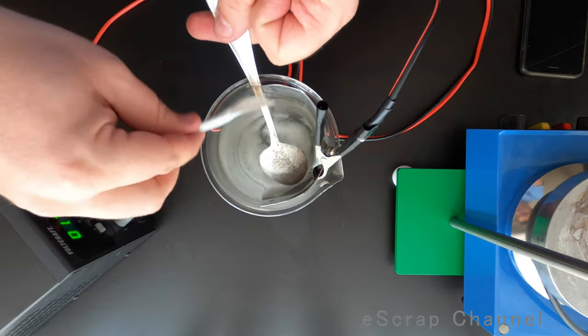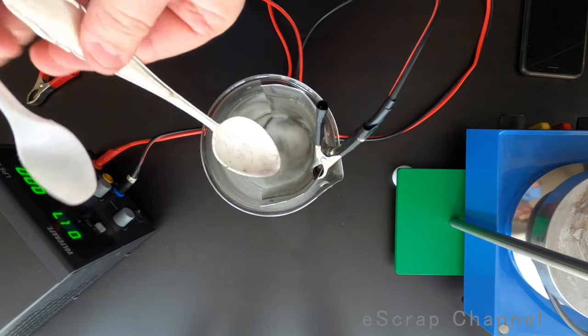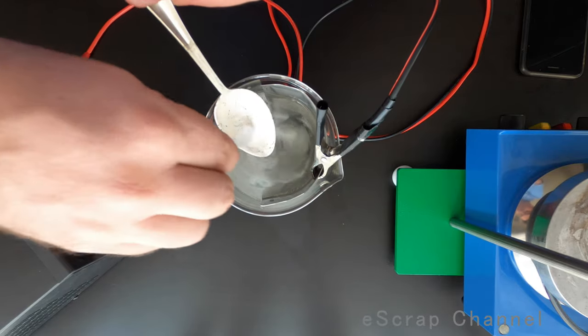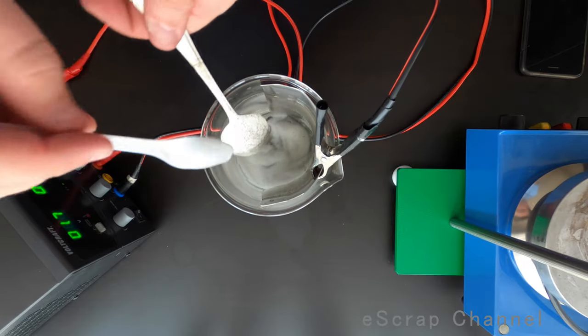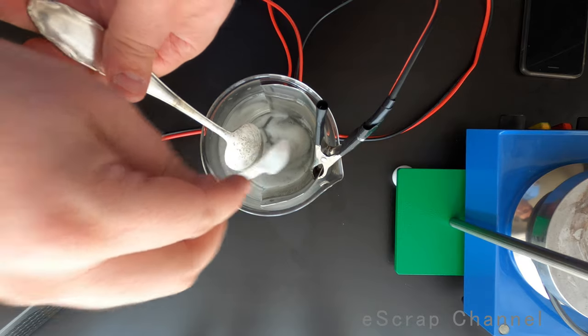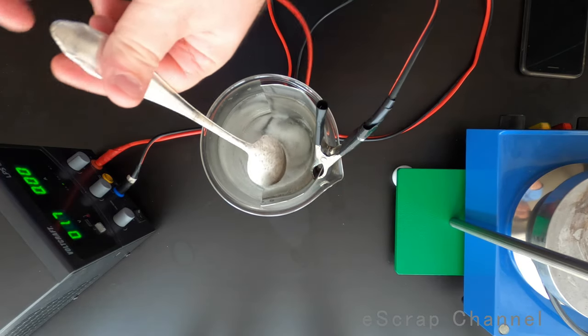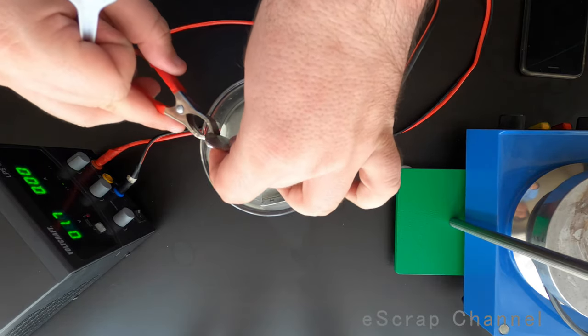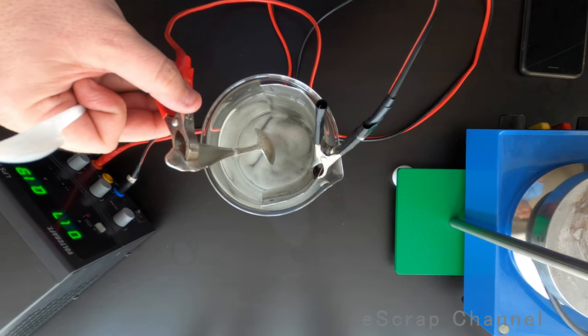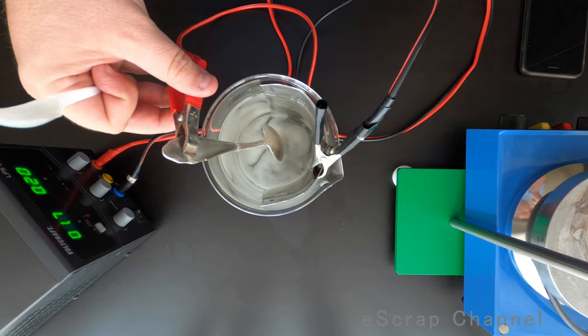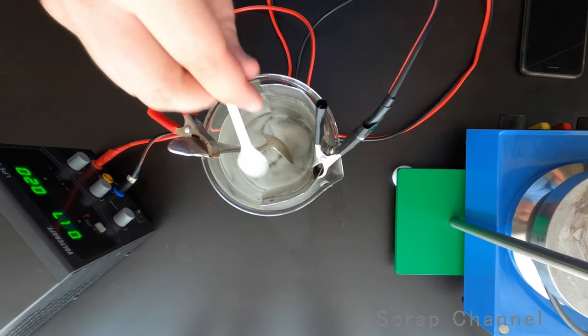So that is what is left at the end. All the silver falls and that's what I said, because the spoon was facing the electrode like this, all the silver from this side is already removed. But on the other side you see that some of the silver is not removed, just because the reaction goes quickest from the spoon to the electrode in this direction. Of course it works from the other side too but it's not that quick. So I will just rotate it now like this. That's, don't mess up. This is a really good power supply actually. If I shorten the circuit nothing will happen, it will just say error and that's all and will continue working. But I don't want to do this.